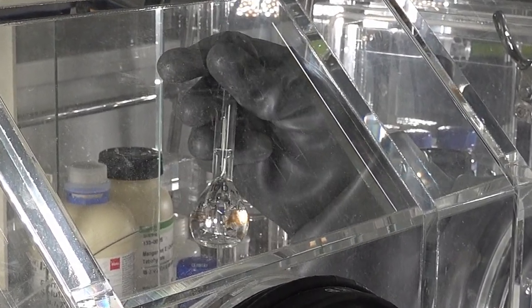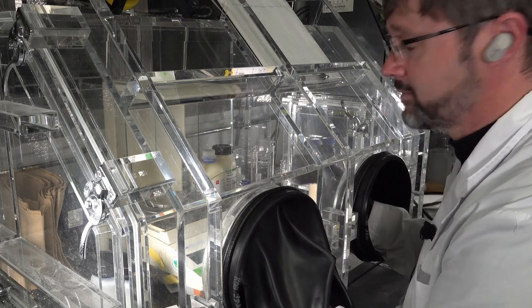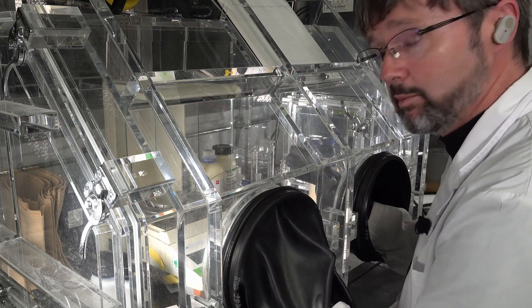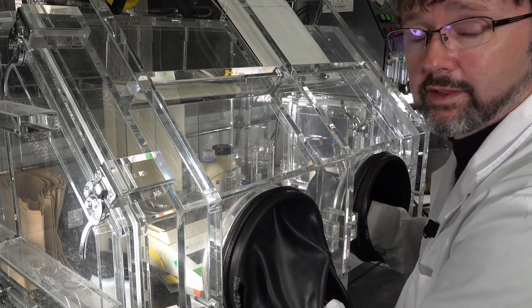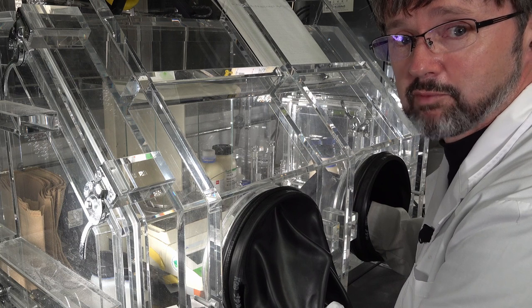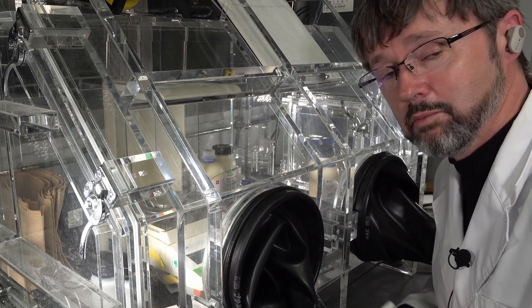So let's add the solvent and dissolve it up. I don't know if you can see it. It's my buffer, all made up. And because it's in the nitrogen atmosphere of this glove box, it'll be stable for a few days. So I don't need to worry about that. I can just come in for the next few days and just do my experiments without having to make it up again. Oh, time for a cup of tea.